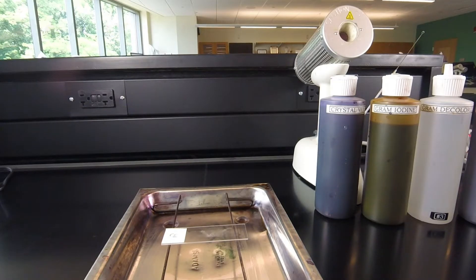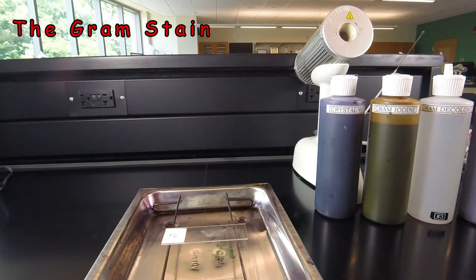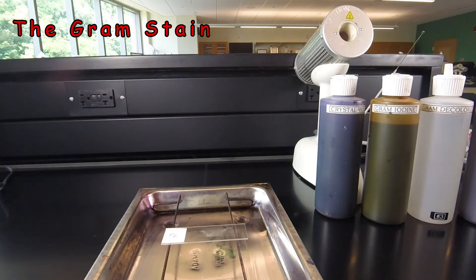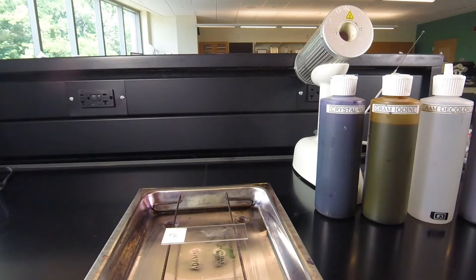In this video lesson, we're going to learn how to perform the Gram stain, the most widely used stain in bacteriology. The Gram stain allows us to determine whether the bacterium is gram positive or gram negative. It's really a four-step staining procedure rather than a stain.